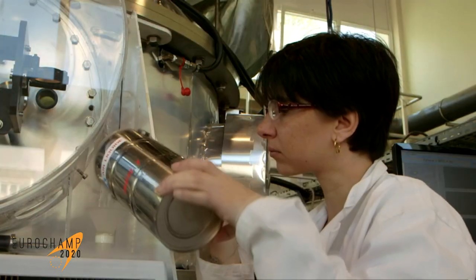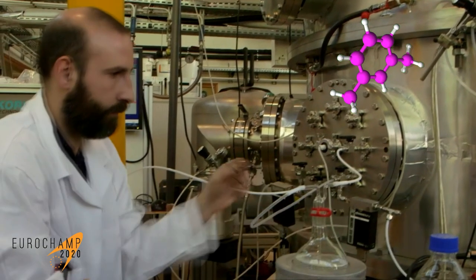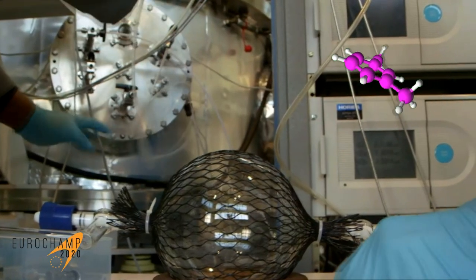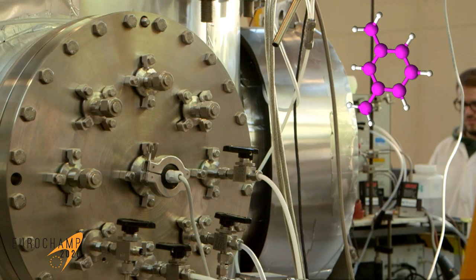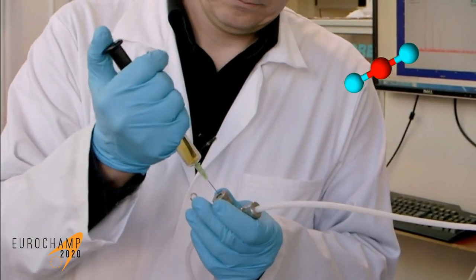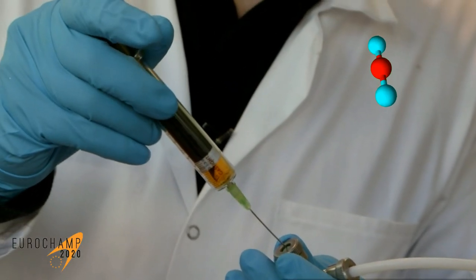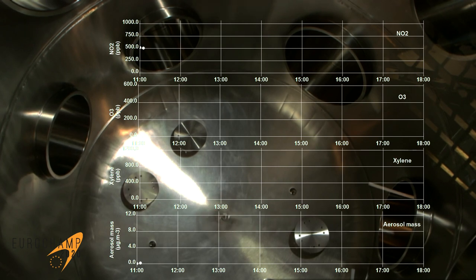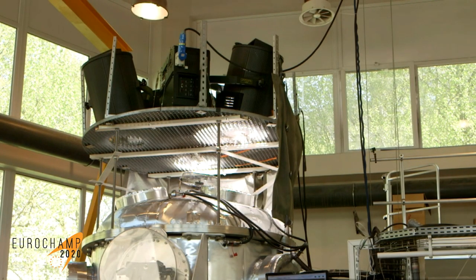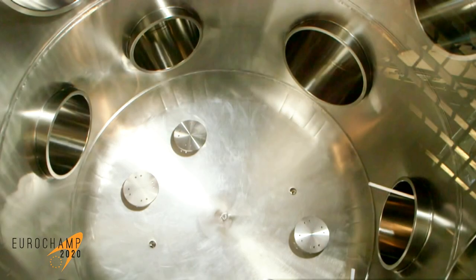In the chamber, the conditions of pressure and humidity of the atmosphere are reproduced under extremely clean conditions. Today, we focus on xylene, a well-known component of solvent and gasoline that is also emitted by unburnt car emissions. A known pressure of diluted gaseous xylene is prepared in a glass bulb of a known volume. This volume is flushed into the chamber through inert Teflon tubing, so that a precise quantity of xylene is injected. Then, a small volume of nitrogen dioxide — a compound emitted by most combustion processes, including car emissions — is injected with a gas-tight syringe. Inside the chamber, the mixture is left to equilibrate. Then, the lights are turned on. These lamps are not only very powerful, but reproduce very well the irradiation spectrum of the sun in the visible and ultraviolet range, which is key for atmospheric chemistry. As soon as the lights are on, the photo-oxidation cycle begins.